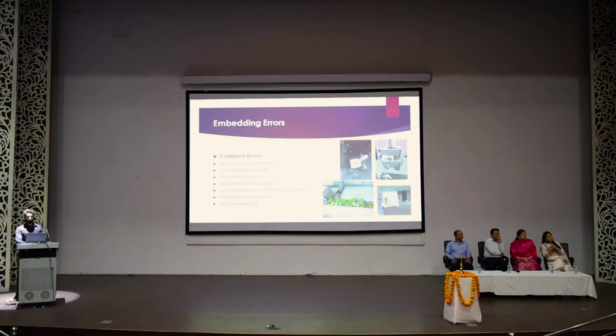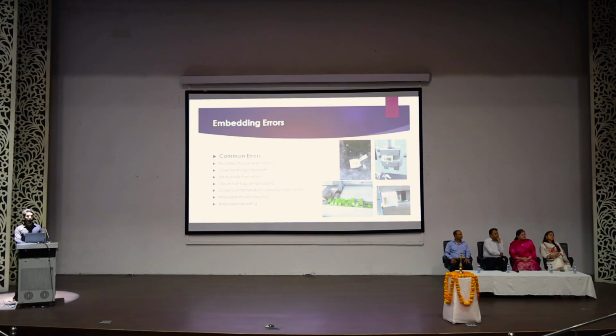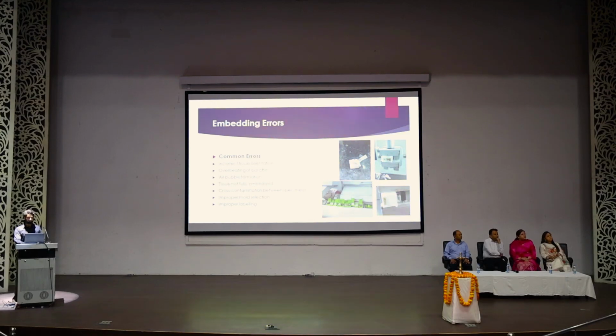And you can see here, there is a crack. There is a crack present here. As I told you, the possibility of cracking is when the block is cooled rapidly after formation of the block. So when multiple plastic tissue cassettes are opened during embedding, there is always possibility of cross-contamination of specimen.